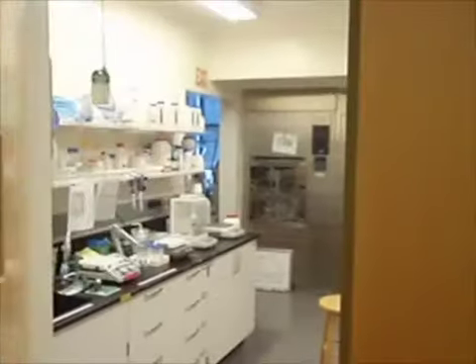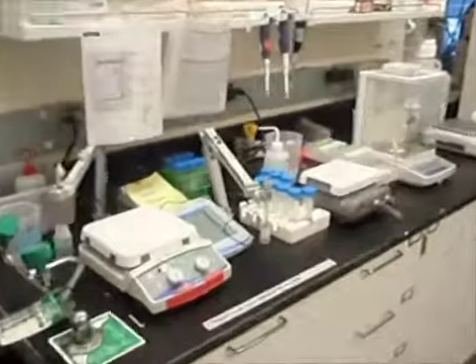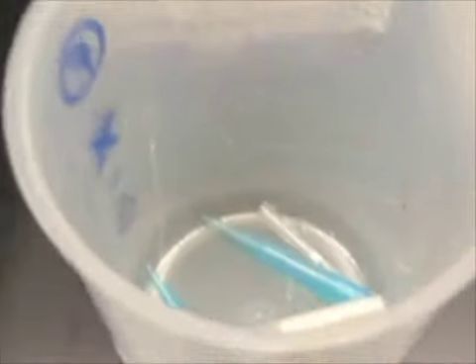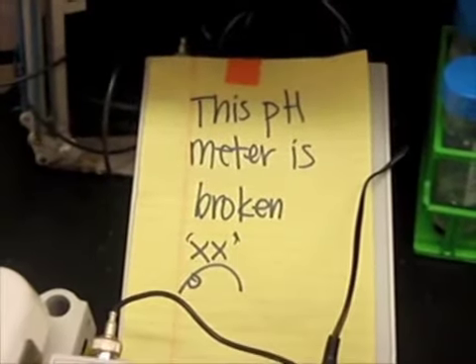A typical morning at the Molecular Foundry starts with media preparation. Here's what the room's supposed to look like. And here's what our scientists frequently encounter instead. Messy, messy, messy. And with consequences far beyond just feng shui.